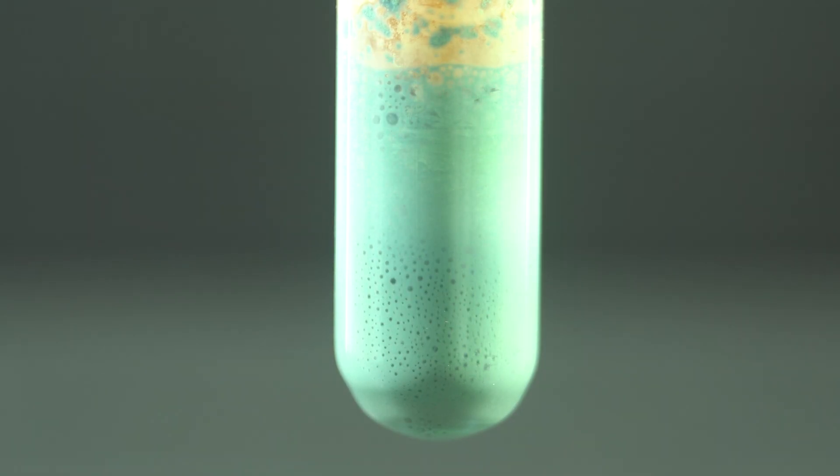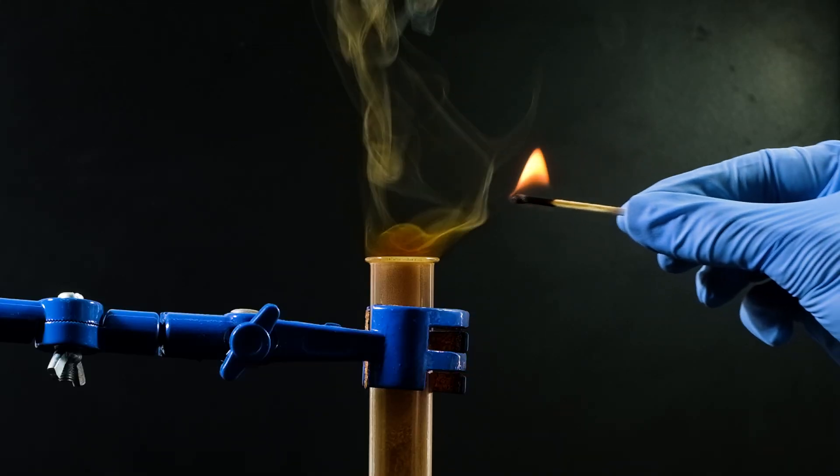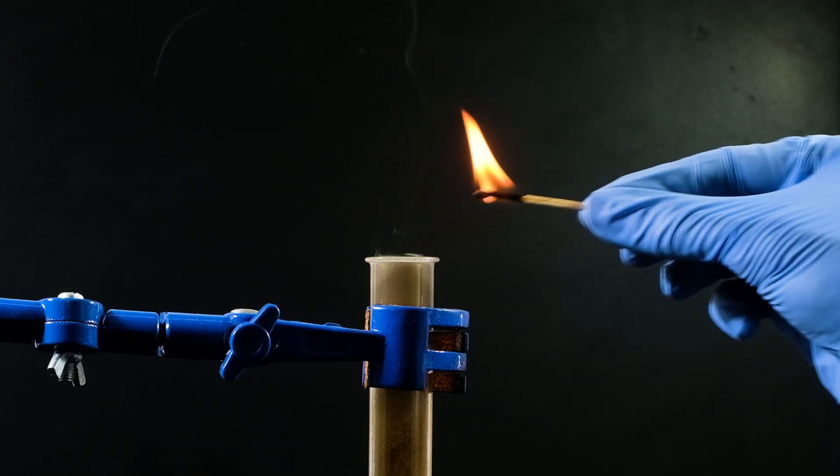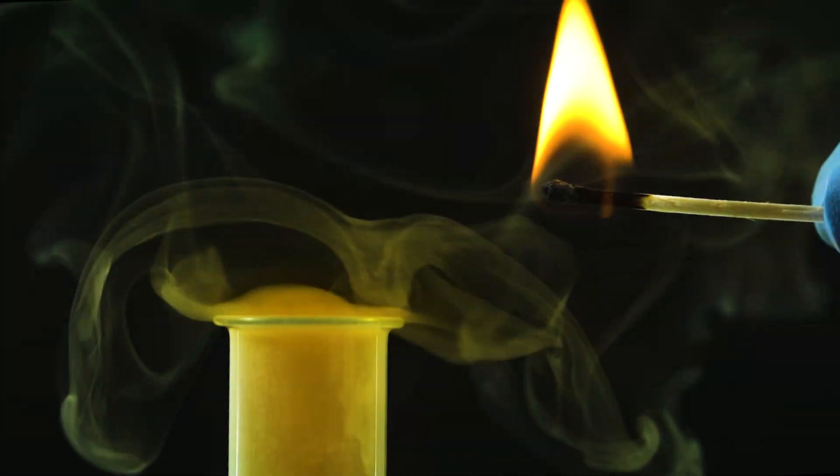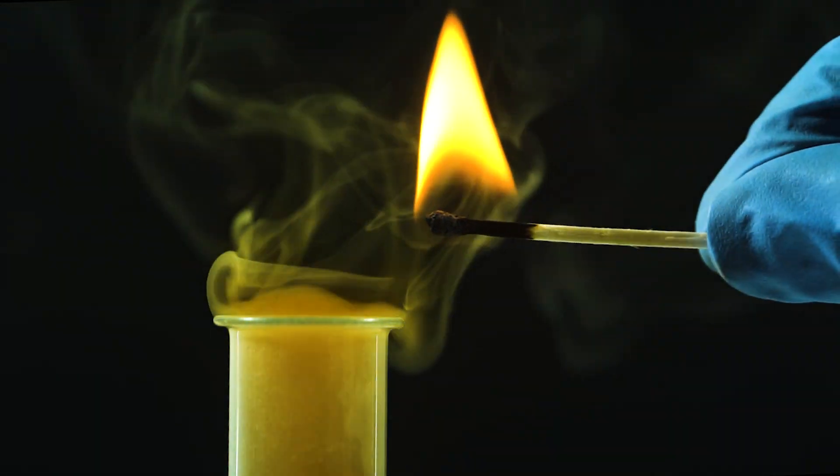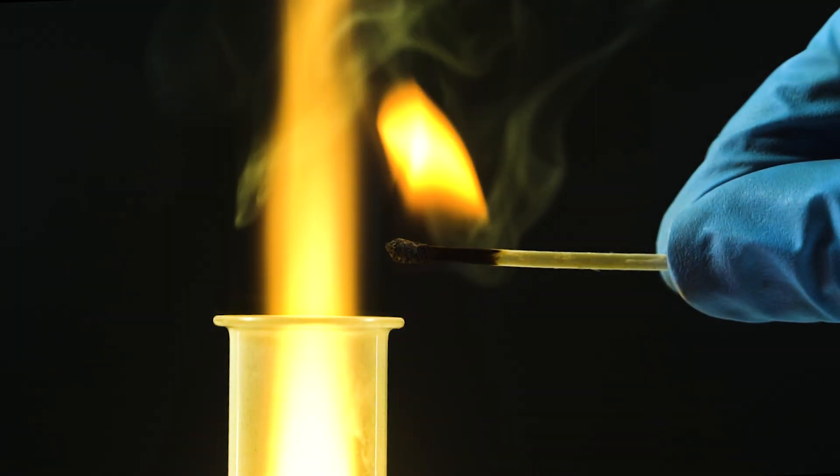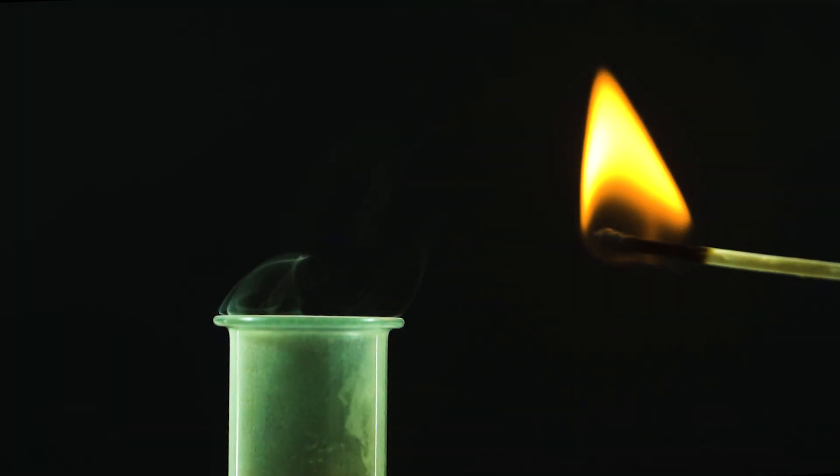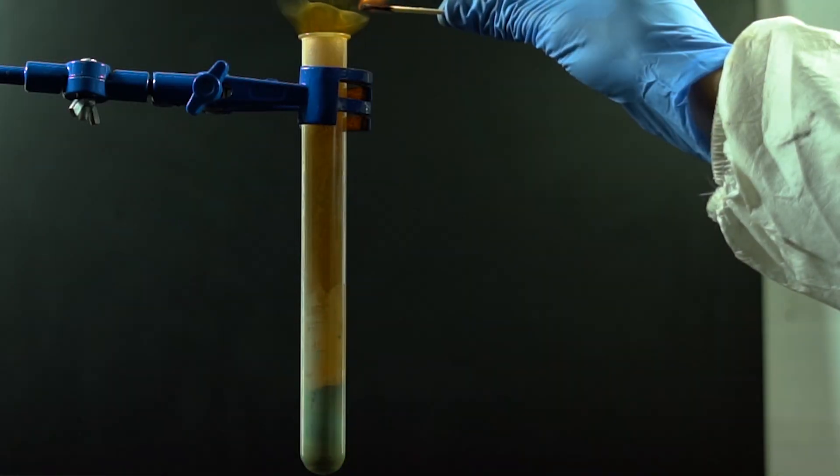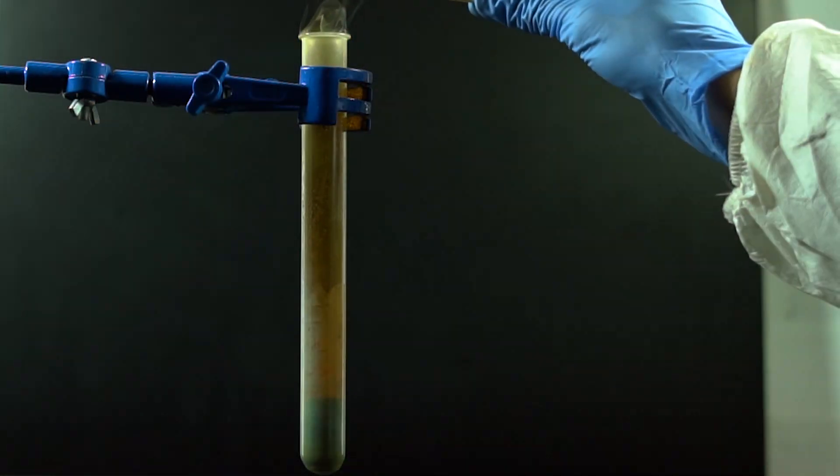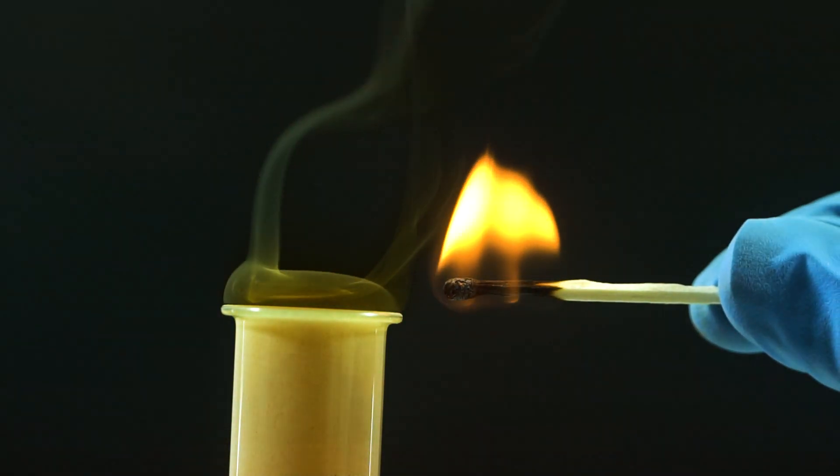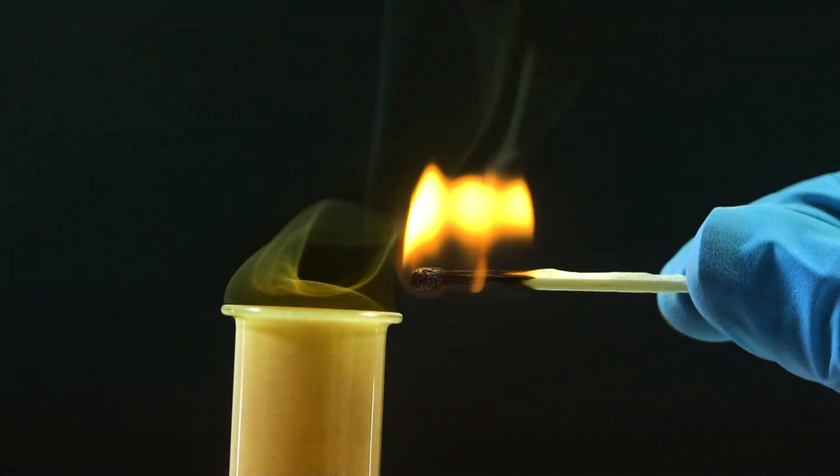Take a look at these reactions from different angles.